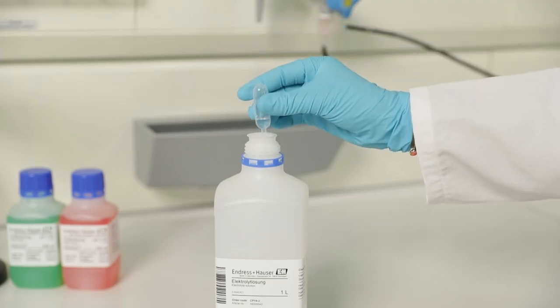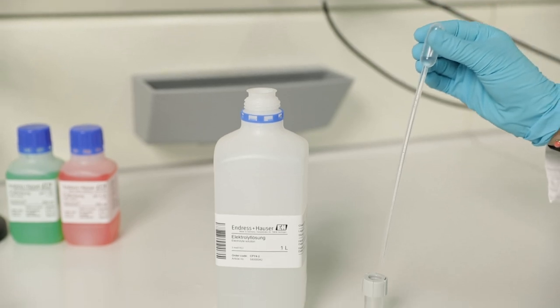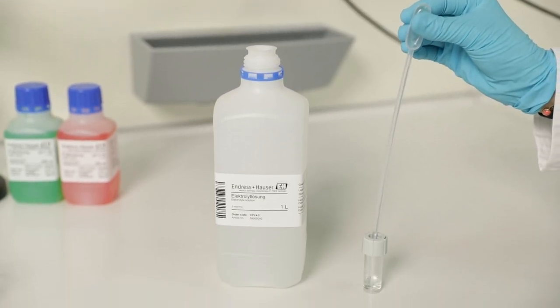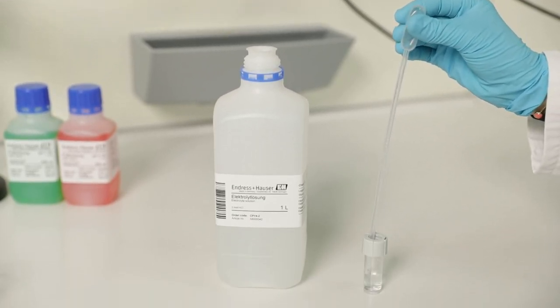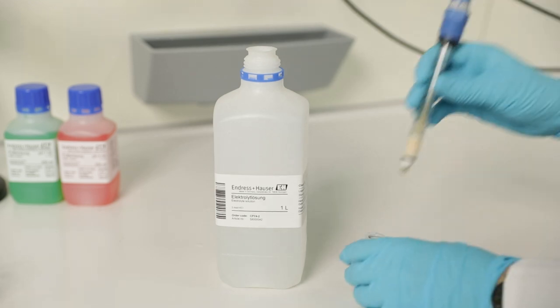Fill the protective cap with KCL solution and put it on the sensor.